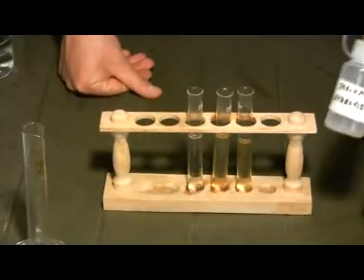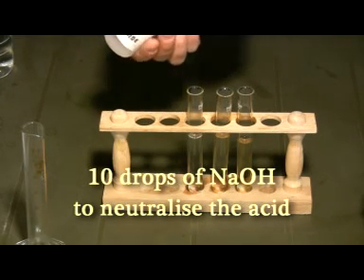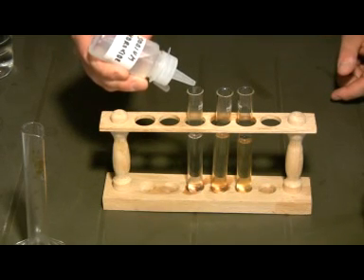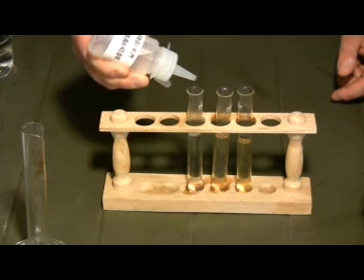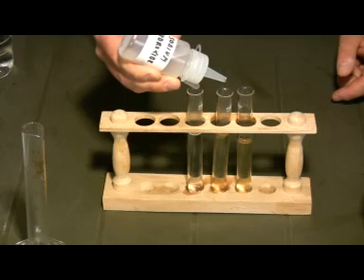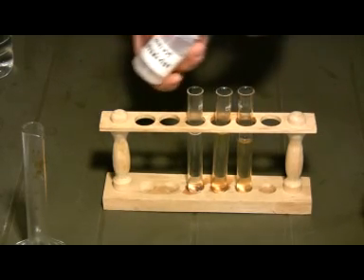While they're cooling down, you have to neutralize the hydrochloric acid, so you need to add a few drops of sodium hydroxide. And once again, you don't touch that one here.